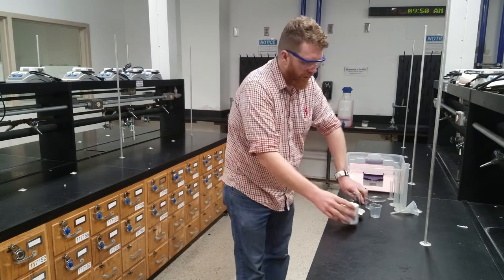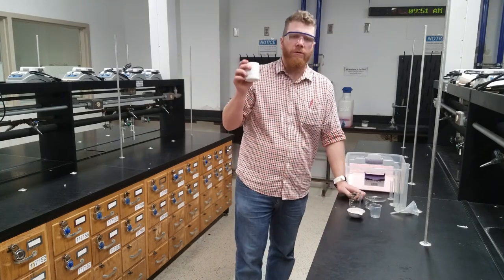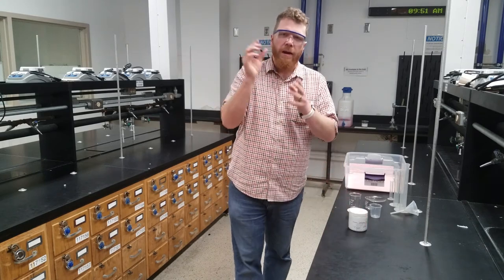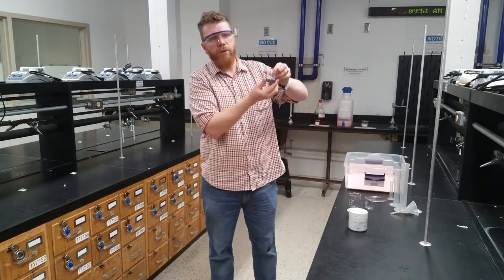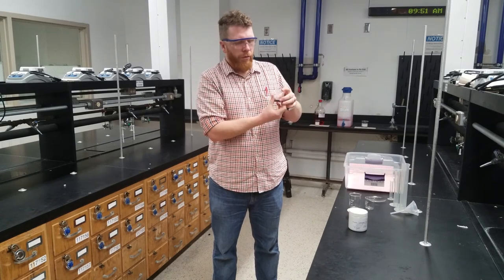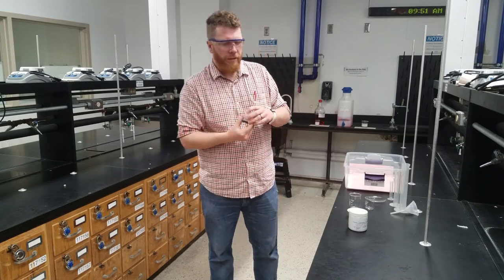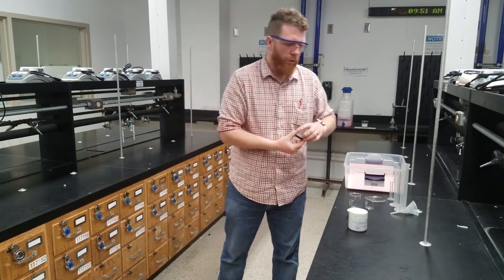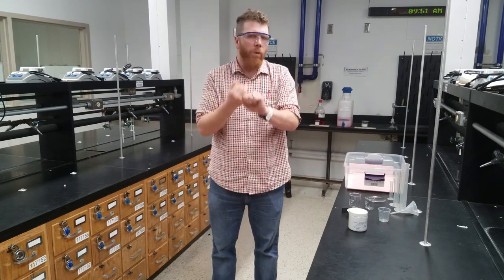The first thing you're going to be able to do is collect a small amount of the sample and use your magnet. Place that magnet on the base of your plastic beaker that has your sample, and what's going to adhere to the base is your iron shot — the metal in this mixture. Once you've done that, of the three different things in there, you've gotten rid of one of them.